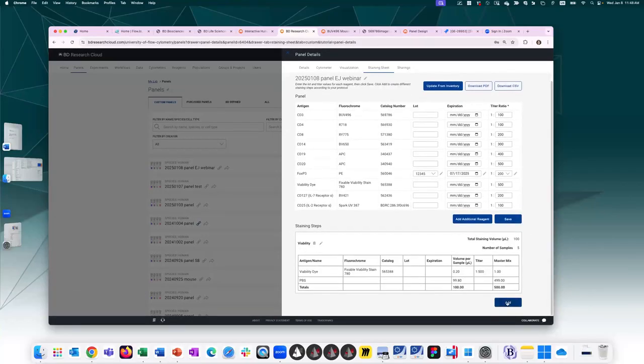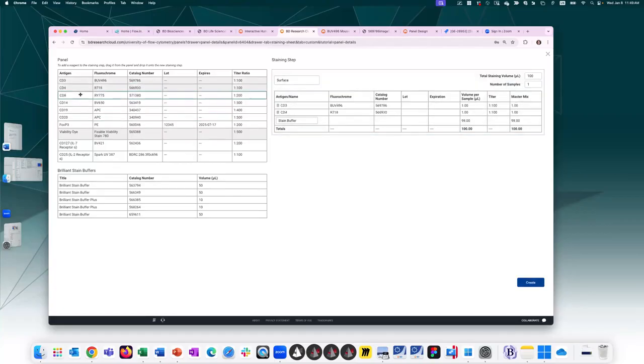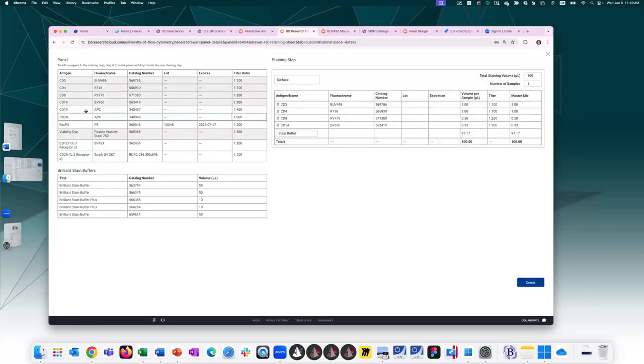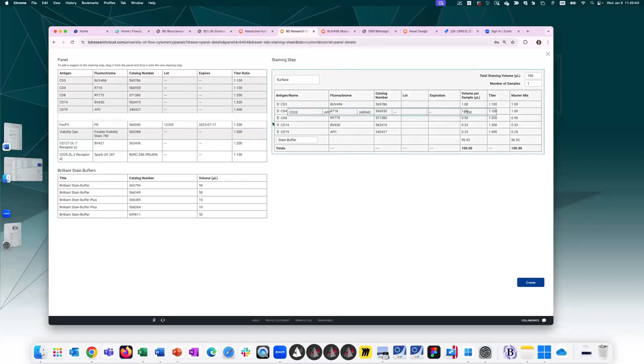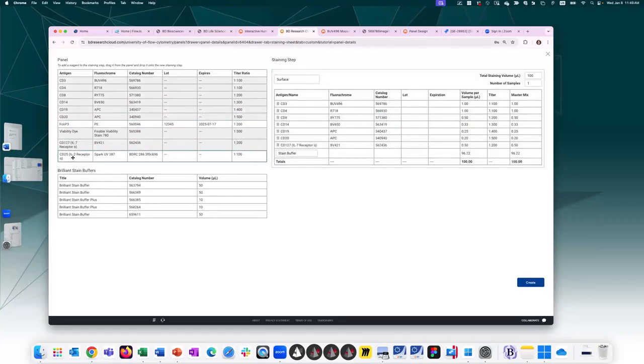And I want to add a second stain step. When I press it again, now it shows me which ones have already been included in previous staining step. This is staining step 2. I'm going to go ahead and say this is my surface. So I want CD3, CD4, CD8, 14, 19, 20, not FOXP3. This is intranuclear. This is surface as well.